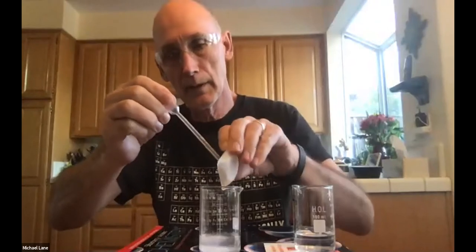Again, a little bit of caution. The sodium carbonate is mildly caustic, right? If you get some on your skin, it's not a big deal. Now, again, what you can see is I have some sodium carbonate that's hung up on there. So I'm gonna just rinse it off with a milliliter or two to make certain that I get everything that I weighed out in there. There we go. Save that for possible future use.